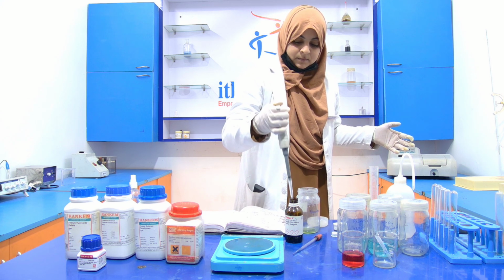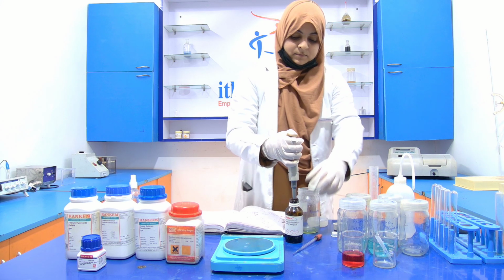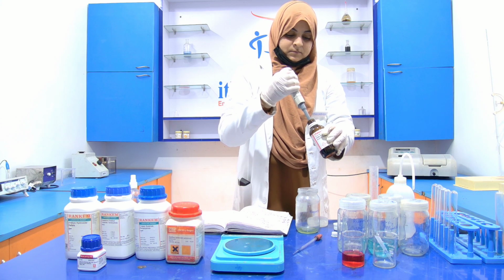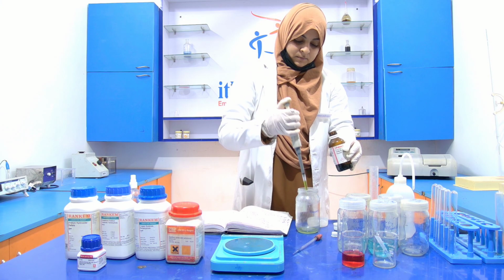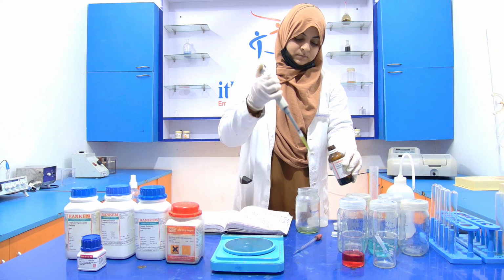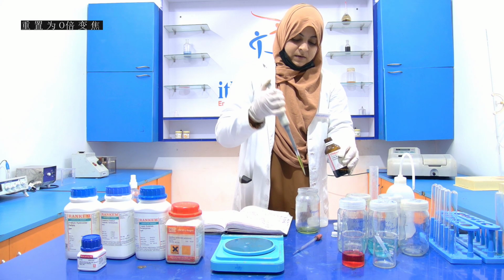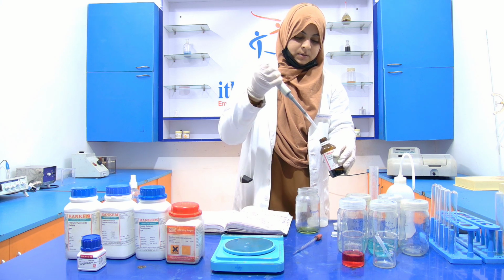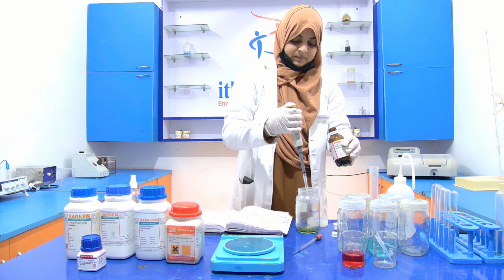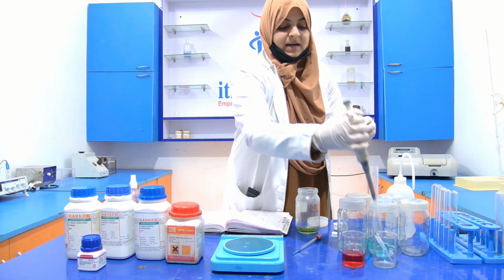1, 3, 4, and this is 5. Okay, so just discard the tip.